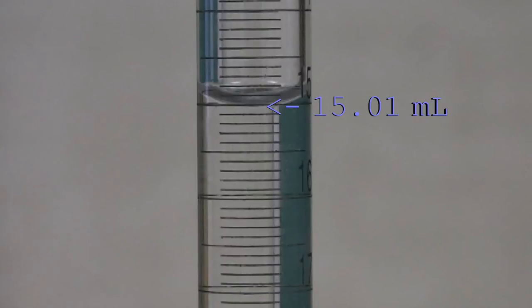When you have reached your end point, take the final reading, which in this case is 15.01 milliliters.